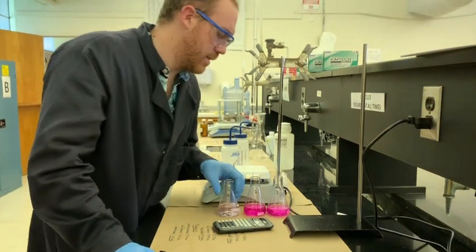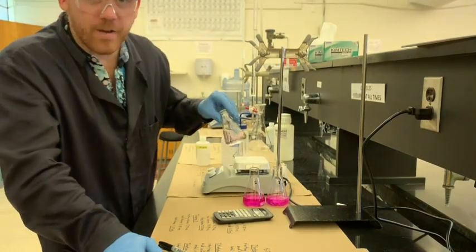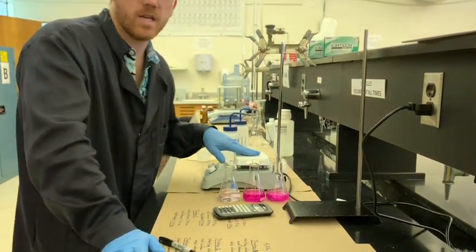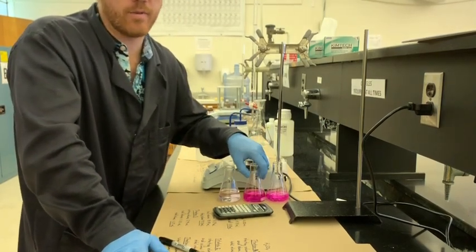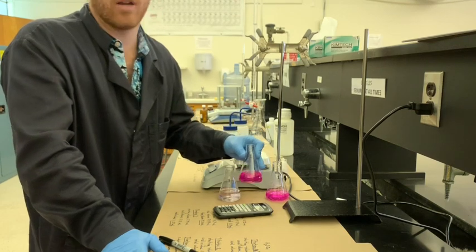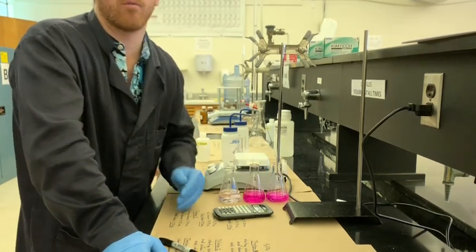So by comparison, these 3 are not extremely good samples. The last one came out pretty well. It's very, very faint pink. You can only see it against the white. And usually it's good to keep a piece of white paper underneath, especially if you don't have a stir plate handy. These are only a couple drops past where they're supposed to be, and they'll still be quite precise. The calculations will work out well because, especially for this one, we actually recorded it at the earlier volume for the final volume. That'll end up being closer to the real final endpoint that we're more interested in.